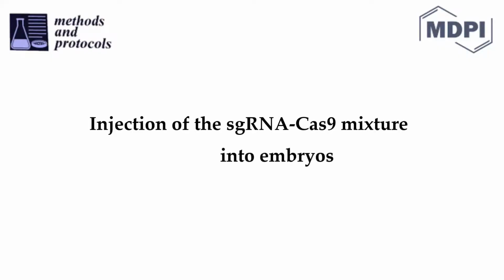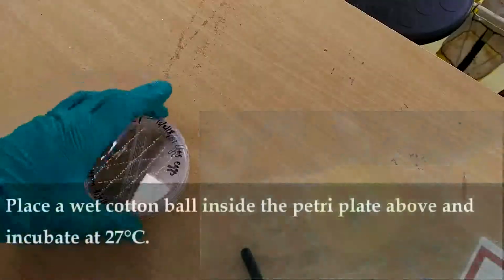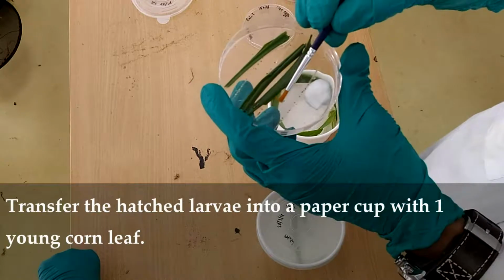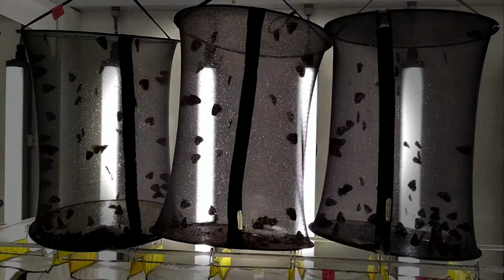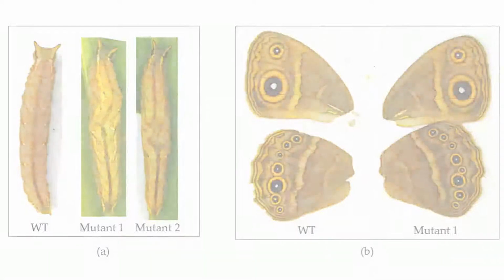Injection of sgRNA Cas9 mixture into embryos. Carefully inject a small volume of sgRNA Cas9 mixture into the embryos. Place a wet cotton ball inside the Petri plate. Embryos will take 3 to 4 days to hatch. Rearing hatchlings and screening for mutants. Transfer the larvae into a paper cup with 1 young corn leaf. Keep note of any changes in the phenotype and image the abnormal individuals.